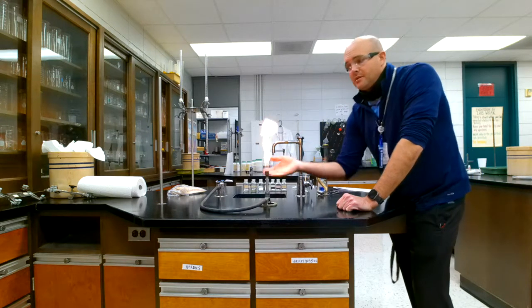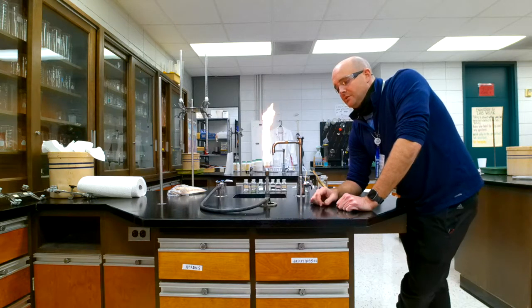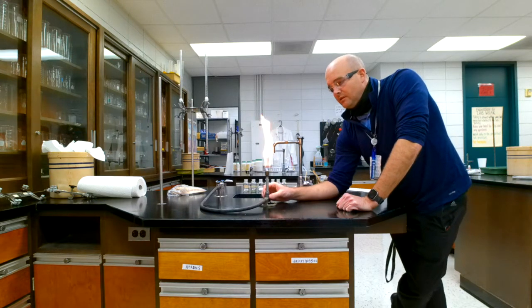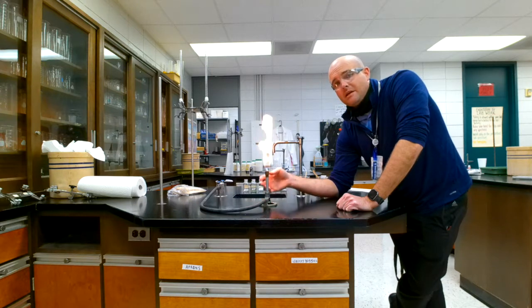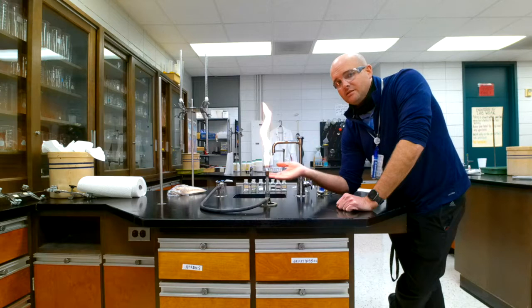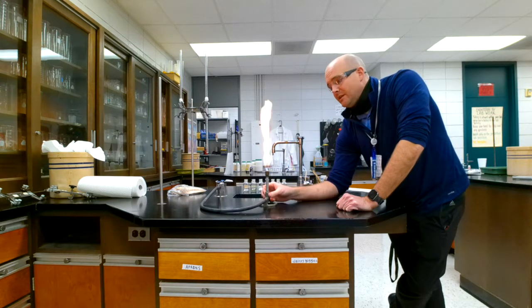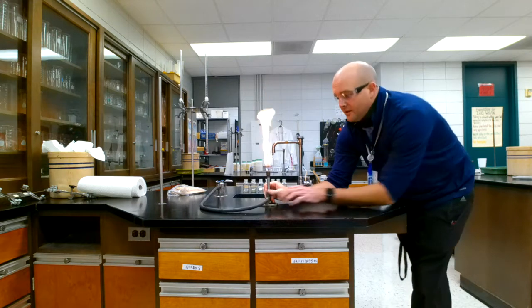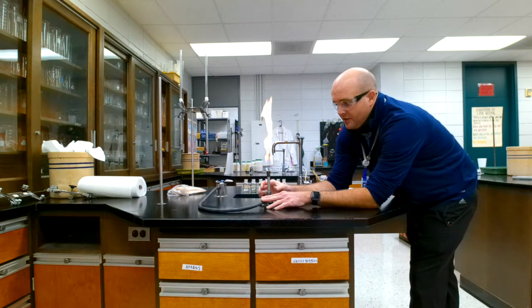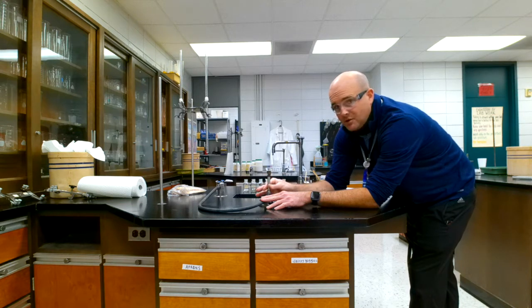So right now you'll see where we're getting a yellow flame, which is not very hot, not very good for heating. What we'll do is we need to increase the amount of oxygen that's coming in. This is called incomplete combustion, and so you're releasing carbon monoxide, and it's not that great, and we want it to have complete combustion. So we're going to add some oxygen just by twisting the barrel here. You'll notice that this barrel is totally cool, all right? I can touch it, no problem.